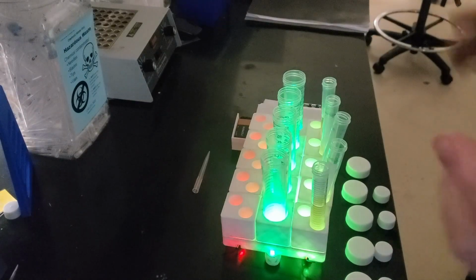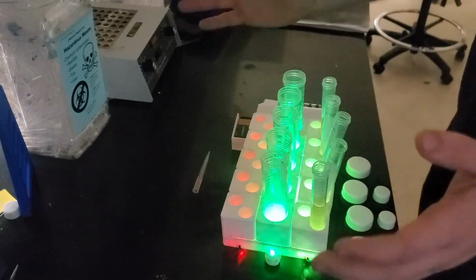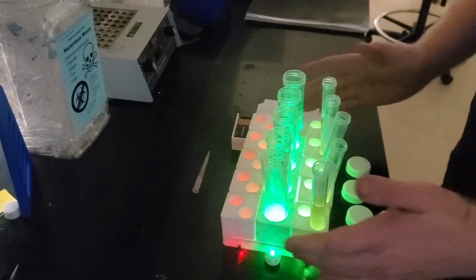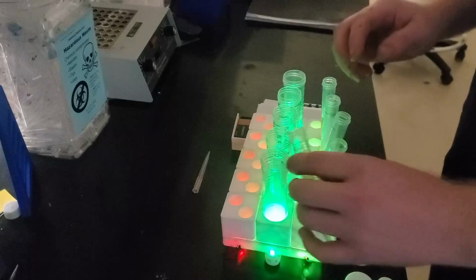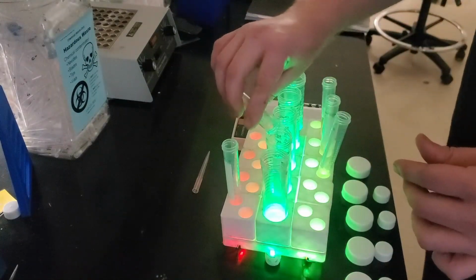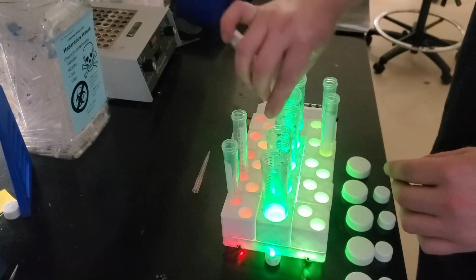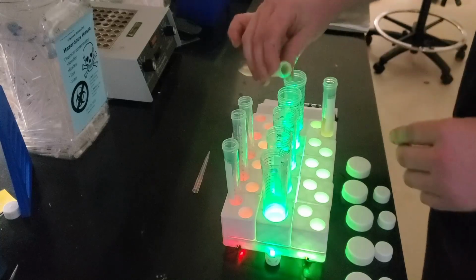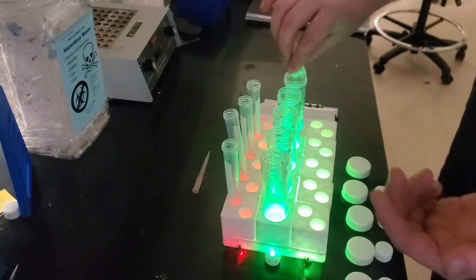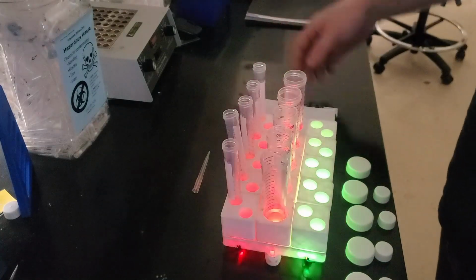So here we have it, folks. Months of work, all in its over-engineered glory. A tube rack with color light indicators designating the hold, go, and no-go zones, allowing us to work multiple different tube types, multiple different designations for our samples, all on a modular, configurable platform. I would say that we have pushed this all the way to the point that we have the world's first smart tube rack.